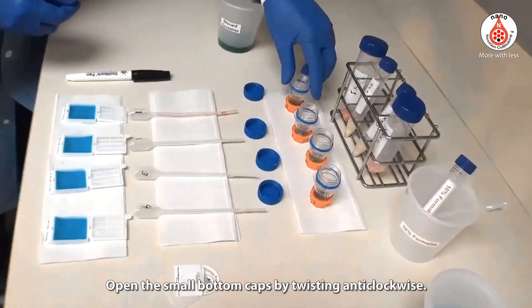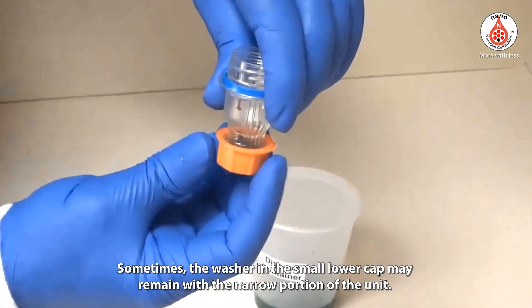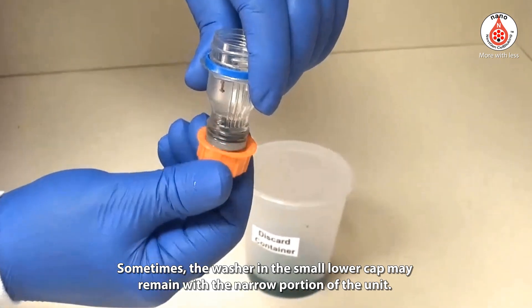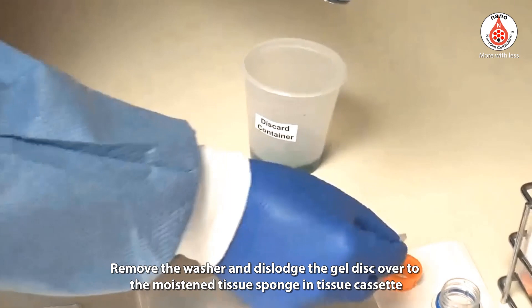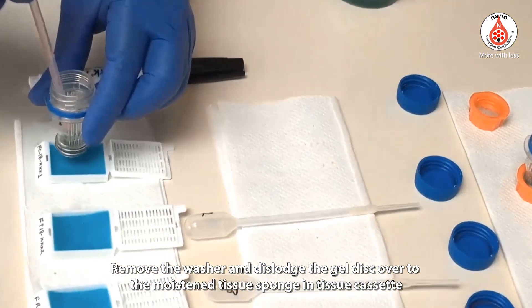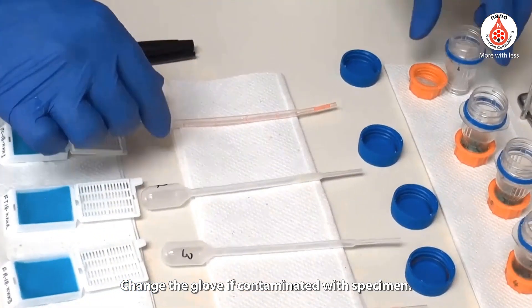Open the small bottom caps by twisting anti-clockwise. Sometimes the washer in the small lower cap may remain with the narrow portion of the unit. Remove the washer and dislodge the gel disc over to the moistened tissue sponge in the tissue cassette by pushing with the tip of the respectively labeled pipette. Change the glove if contaminated with specimen.